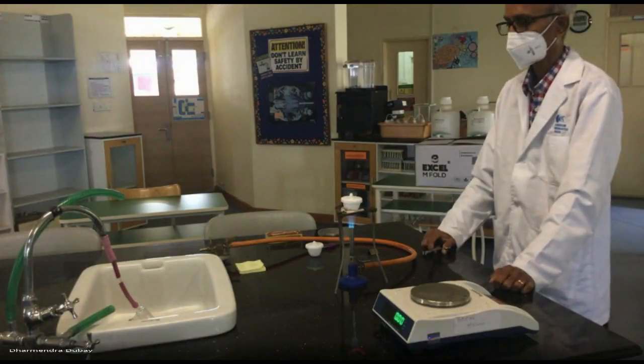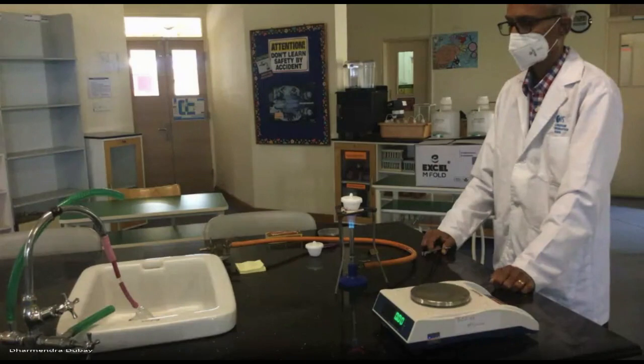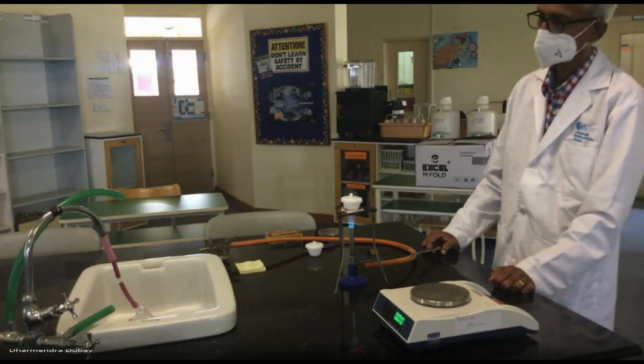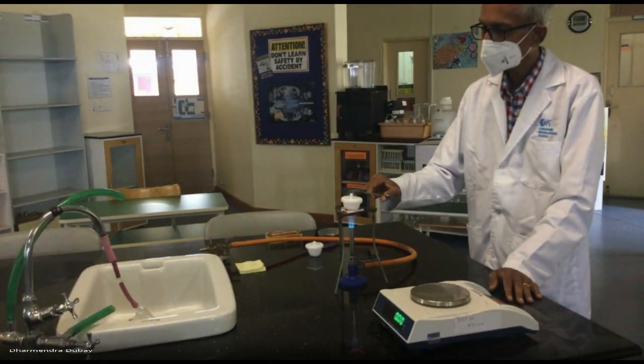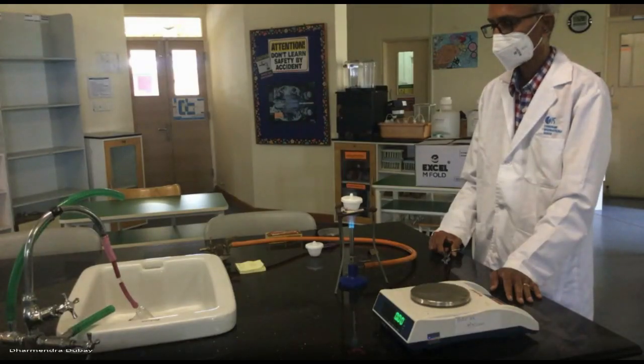Magnesium is getting hot and it's reacting with oxygen. Is there anything else in the atmosphere that's even more so in a higher concentration than oxygen? By three and a half times the concentration of oxygen. It's there. Nitrogen. Why isn't nitrogen reacting with magnesium? But is nitrogen known to be a very reactive thing? No. It has a triple bond to another nitrogen. It's pretty unreactive. It's stable. It's inert.